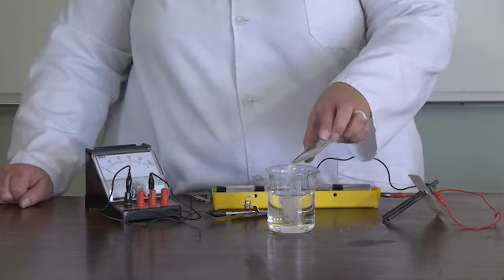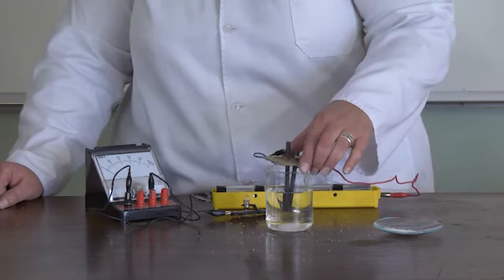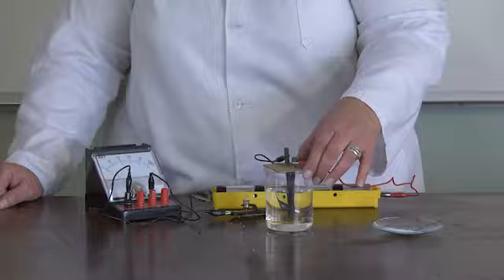Rinse the electrodes. Add some sugar to the distilled water and stir it until it dissolves completely. Place the electrodes in the solution and observe what happens. The ammeter shows that no current is flowing.